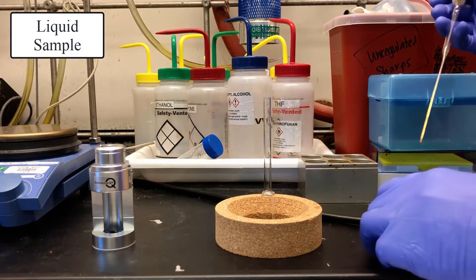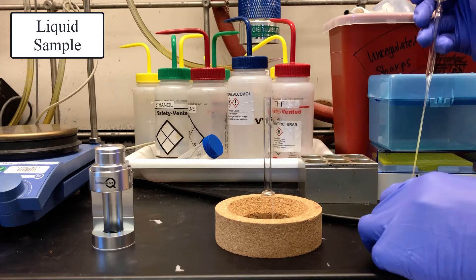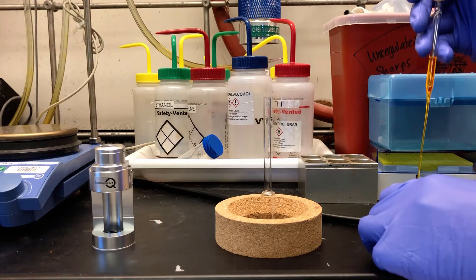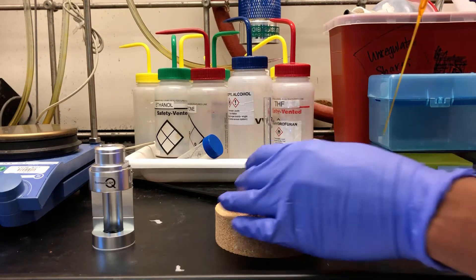We're going to measure the quantum yield of a sample of P3HT dissolved in THF. P3HT has well known absorption properties that we'll use in our test.